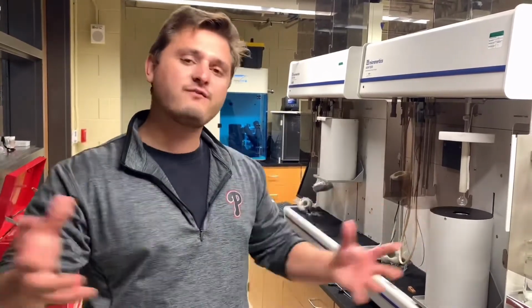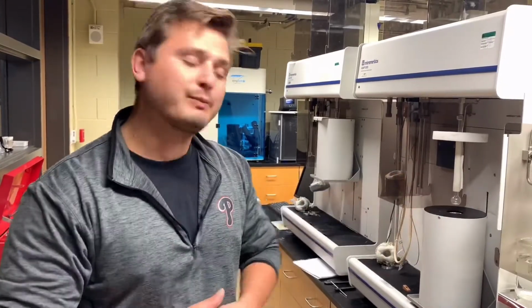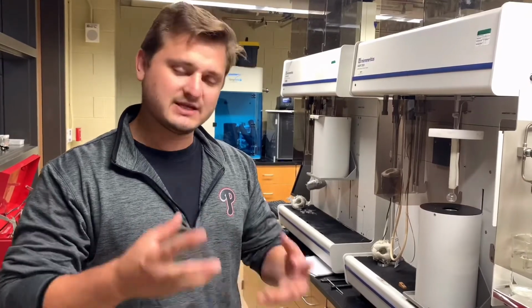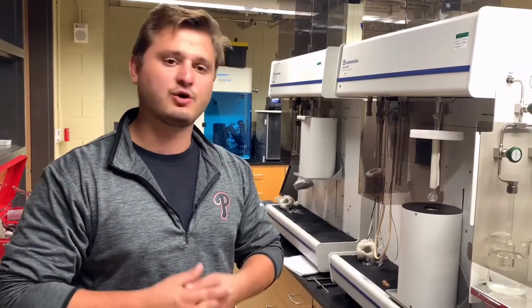all of the things that we might want to look at from nitrogen adsorption, or if we are looking at some other adsorbent, whether it's methane, hydrogen, CO2, or a vapor, such as acetone, benzene, ethanol, water, whatever we are analyzing on this instrument. Referring back to the literature, and to our group knowledge and the senior students' and postdoctoral fellows' knowledge, you can determine whether the data came out successful or something must be rerun or changed as far as the activation or the synthesis of the sample that you are running.